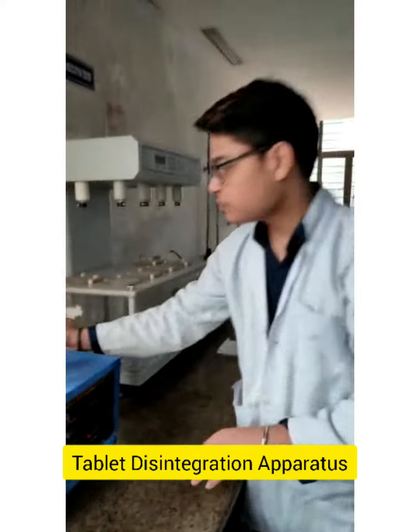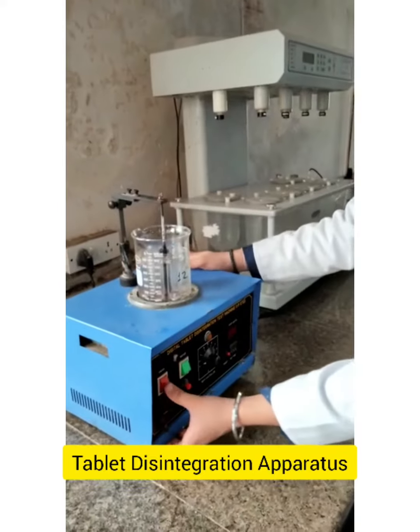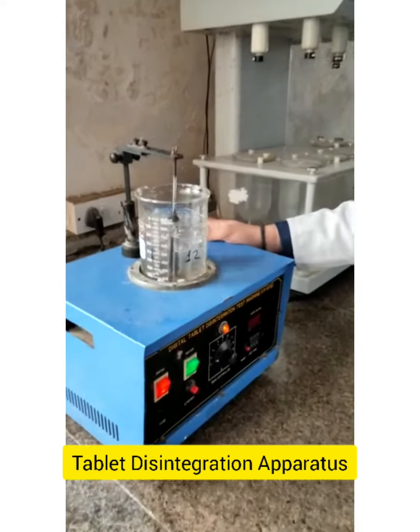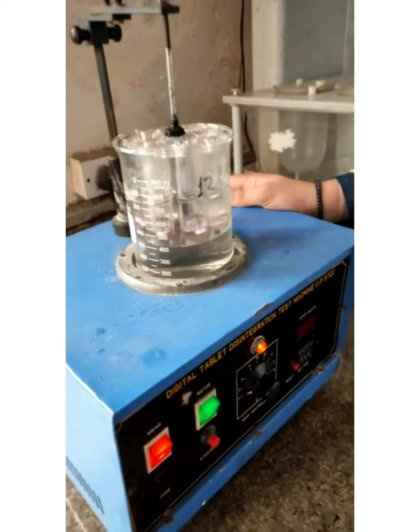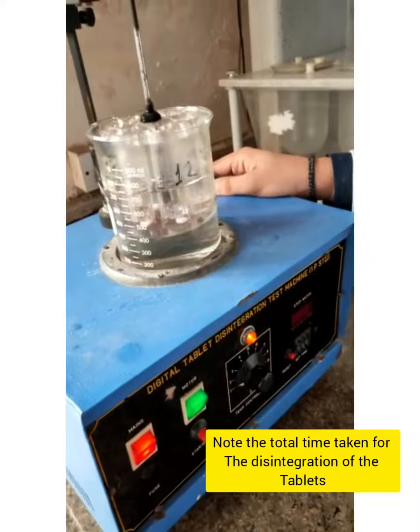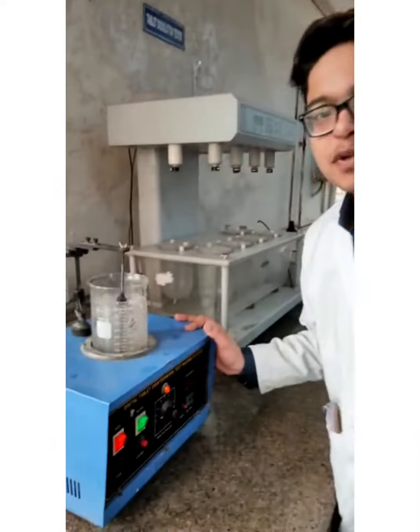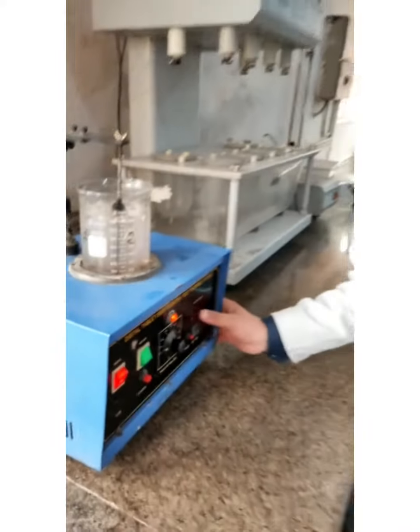Now we turn on our apparatus. We can note the time in which the tablet is completely disintegrated. We have seen that all the tablets have been disintegrated. We turn off the apparatus and note the time for disintegration.